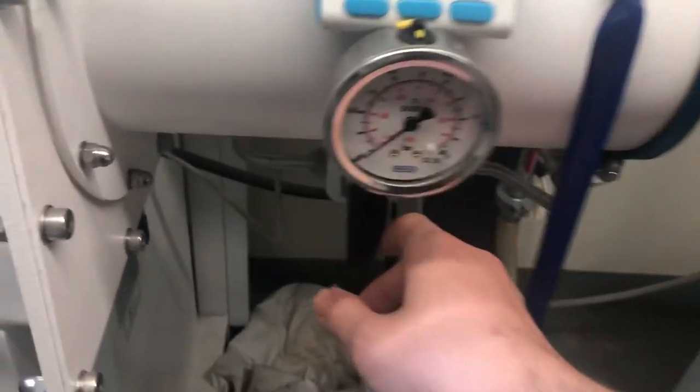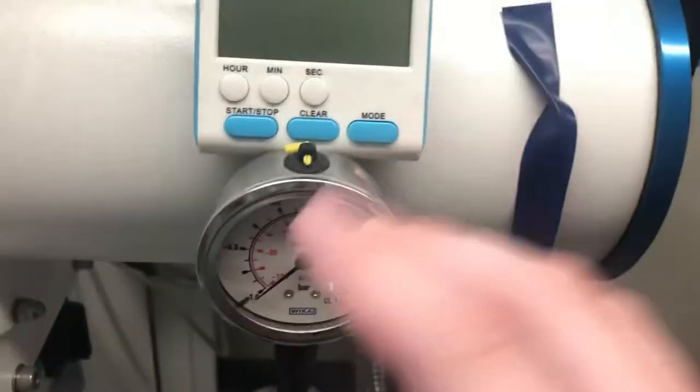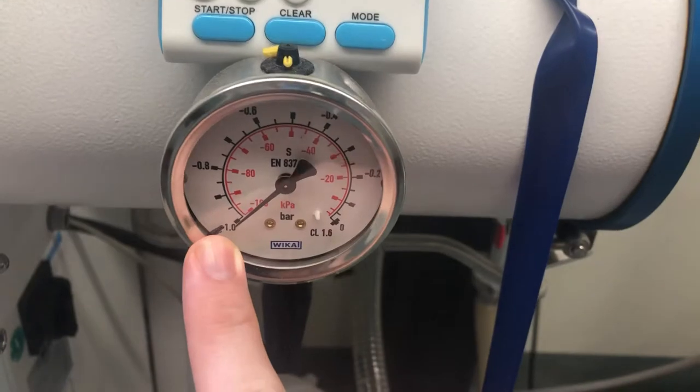When bringing something into this antechamber, you need to look at this pressure gauge. This is your best friend.